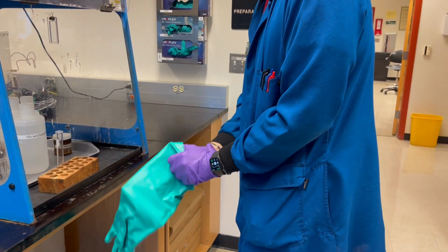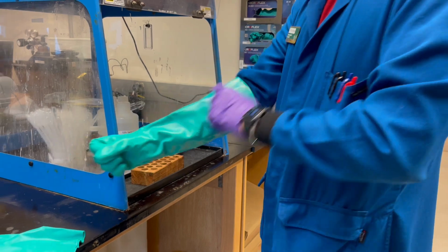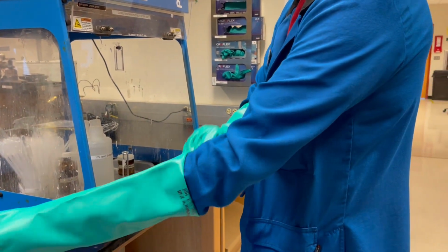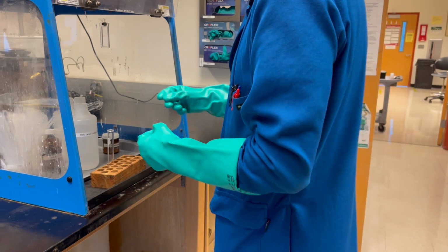So specifically, whenever we're handling with filling a test tube, you wanna make sure that you always have your test tube rack. Now, in addition to that, when we're working on the amine experiments and we're using iodoethane and iodomethane, we have to wear a protective layer of gloves on top of the gloves that we have.